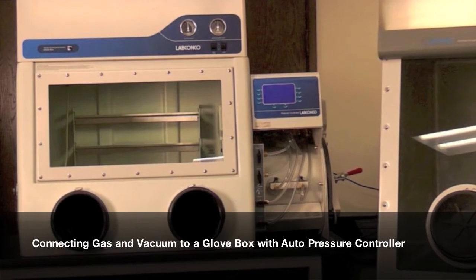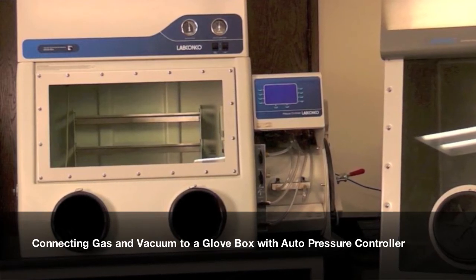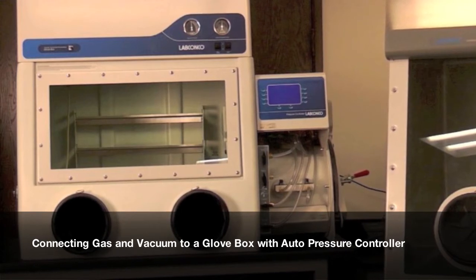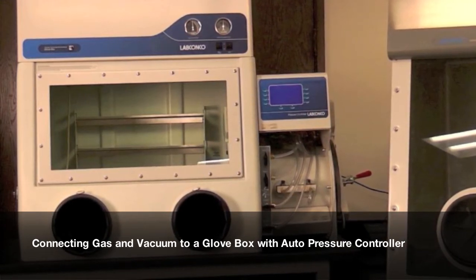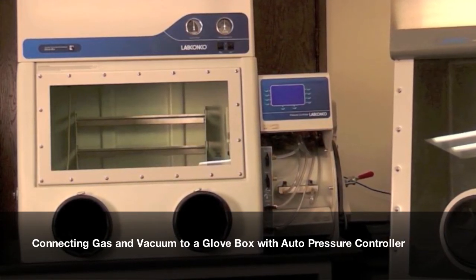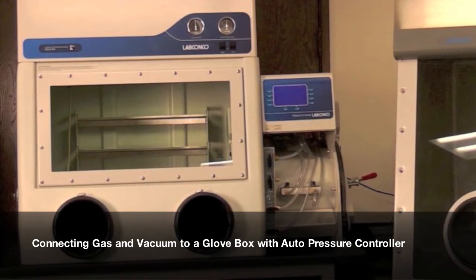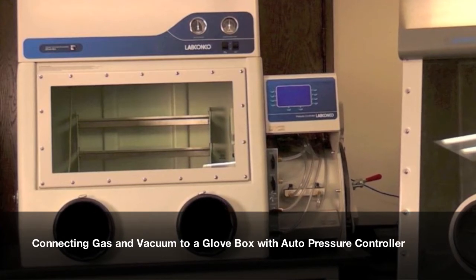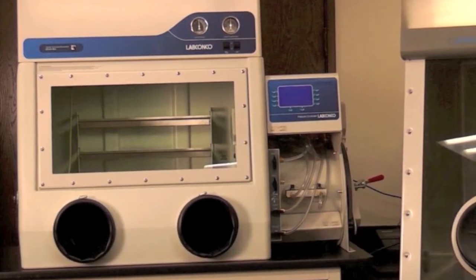LabConco's Protector Controlled Atmosphere Gloveboxes offer basic or advanced operation features for creating inert atmospheres. This video will demonstrate the connection of inert gas and vacuum to a glovebox featuring an auto pressure controller which offers push button control of gas and vacuum pressures.